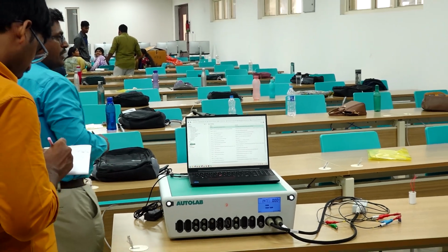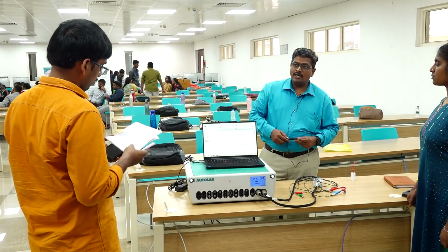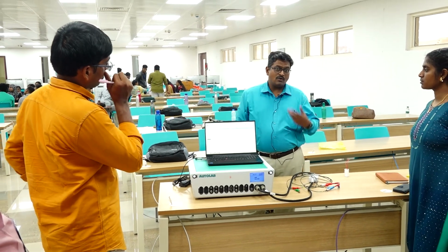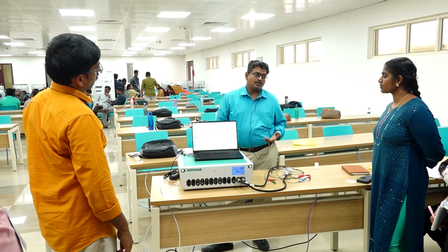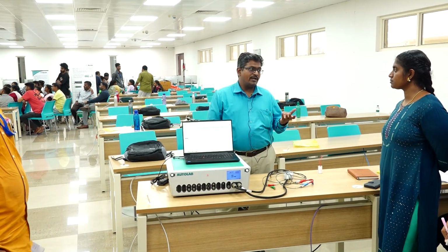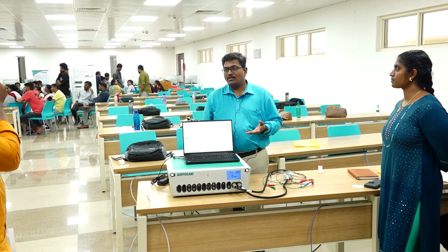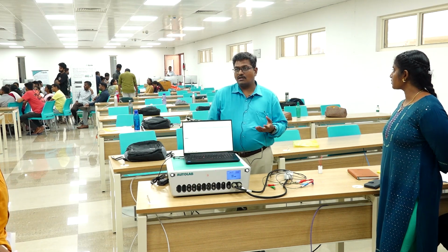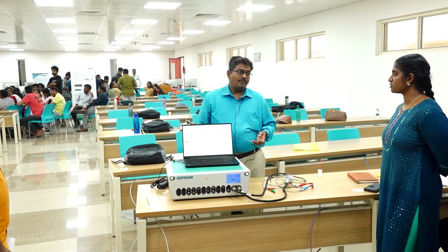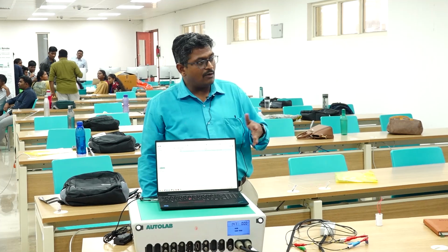Apart from energy storage, we do corrosion studies with this electrochemical workstation. Corrosion can be studied with your SS material or different metal coupons, and nowadays corrosion studies are getting more and more requirements. People are developing many metals with different coatings. You take your simple two-wheeler or car, they are having a metal with different paint coatings. With normal exposed conditions, or if scratches happen, how the rusting is happening, how fast it is getting corroded. If I coat yellow color paint, how corrosion resistant it is. If I coat white color paint, how resistant it is.